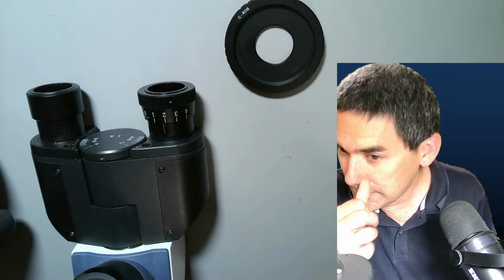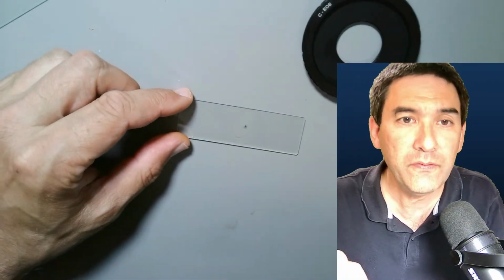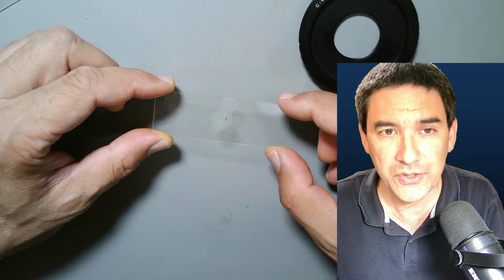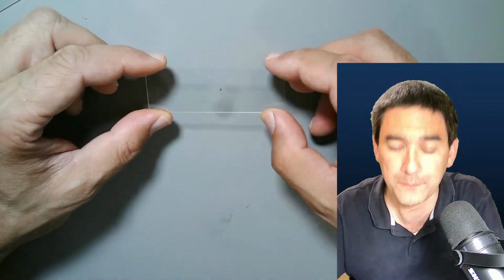Okay, and what time is it? Okay, I still have maybe a short quarter of an hour, and I would like to try another thing here. Some of you were again asking a little bit about cyanobacteria, and maybe you've watched my 2 cyanobacteria videos on this channel. What I've done today, in the morning, is I added some samples containing cyanobacteria on the slide, and I allowed it to dry. So let's have a look at how it looks under the microscope.